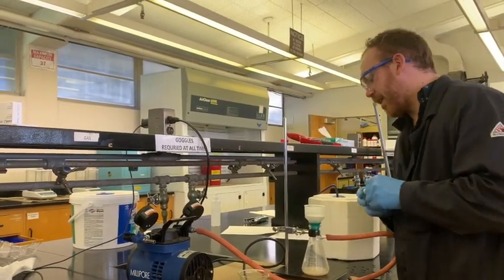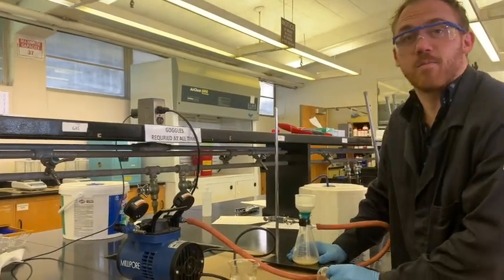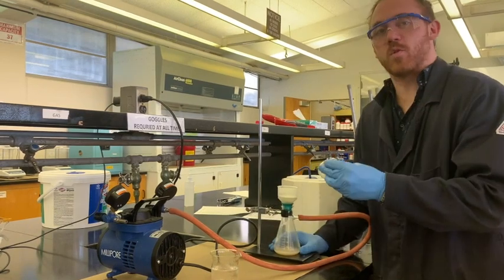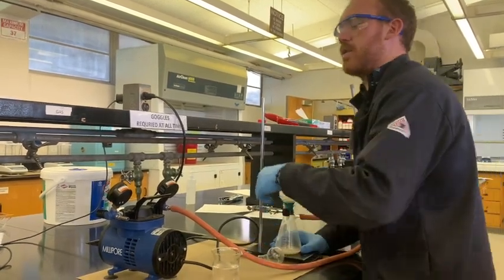So it looks like we lost a lot of that product through the bottom. And that's probably why we would normally use a Hirsch funnel, but it's not too big a deal. We can always just filter it again. Just going to turn this off.